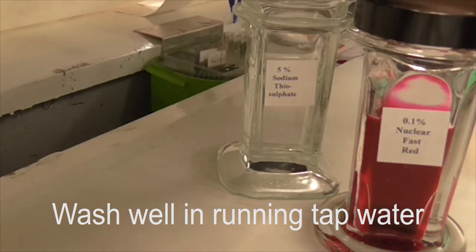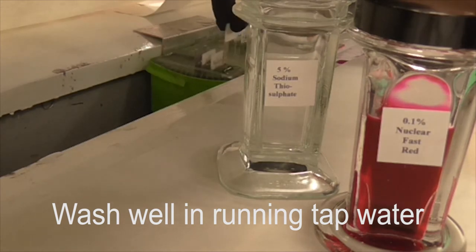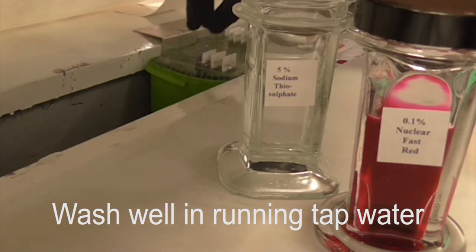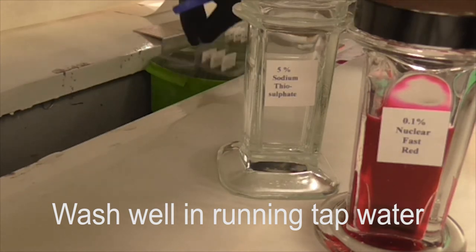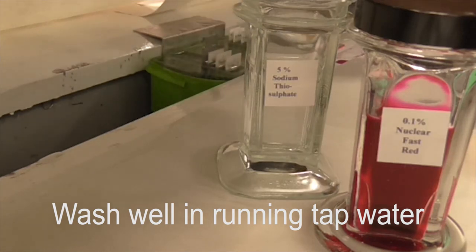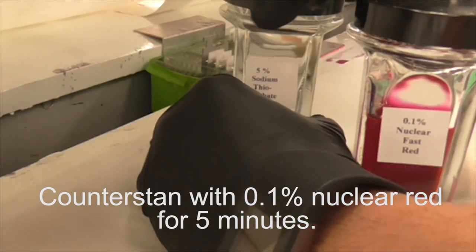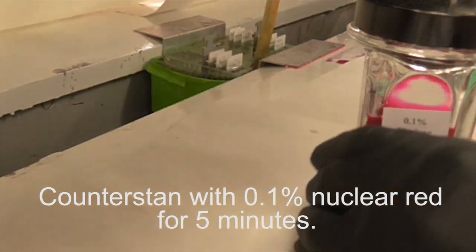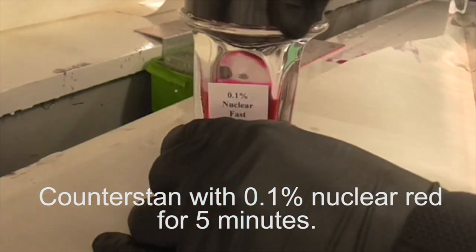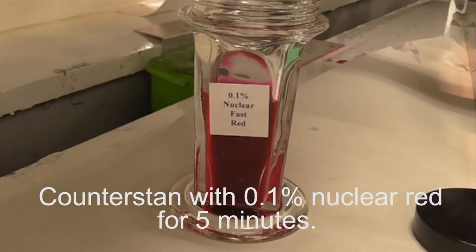We will be leaving them there for a minute, just to be sure all the sodium thiosulfate solution has been rinsed off before we place them into nuclear fast red. Now the tissue sections will be counterstained in 0.1% nuclear fast red solution for 5 minutes.